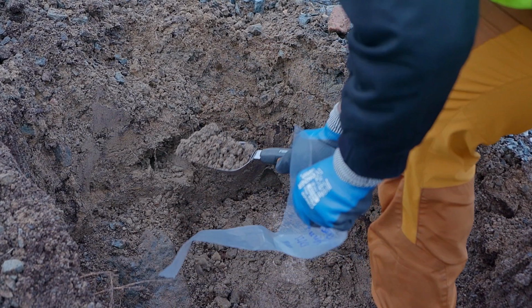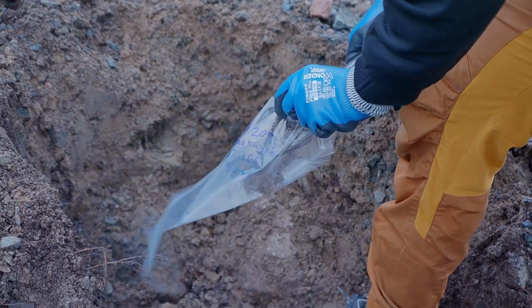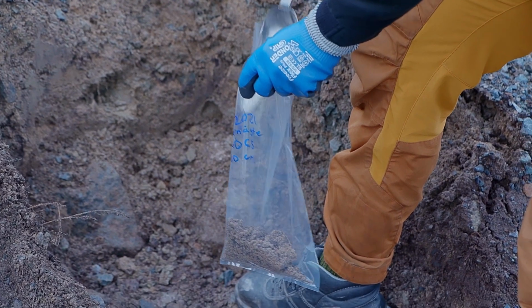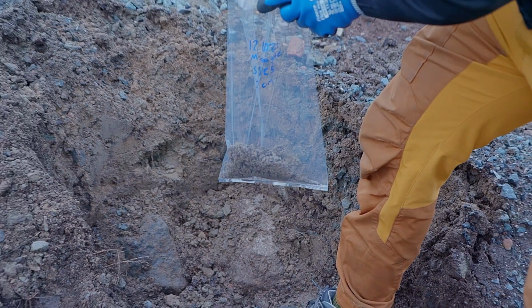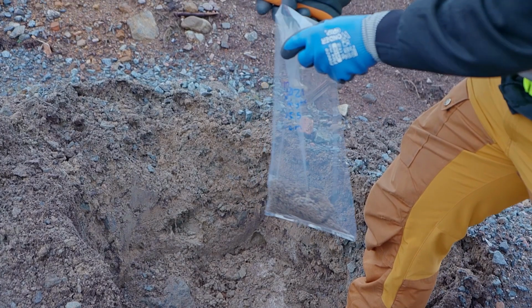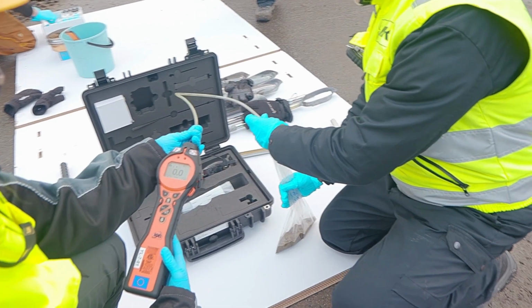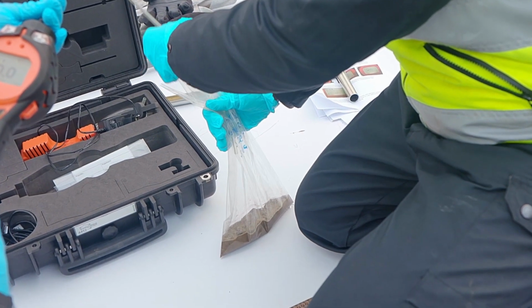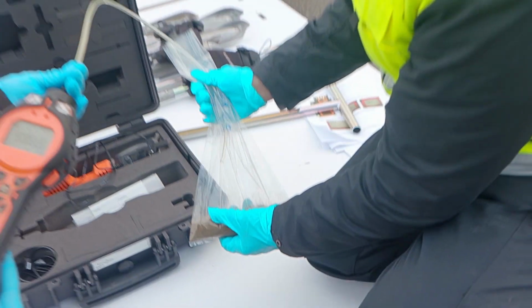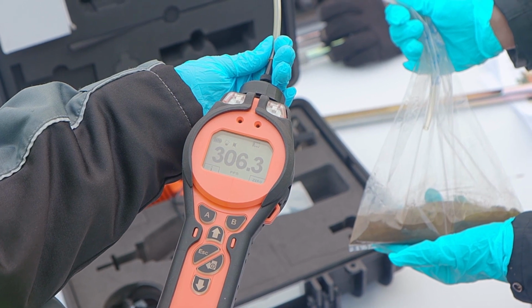Measurements can be taken directly from the soil or, for example, a gas-tight bag containing a soil sample. The gases move from the pores of the soil sample into the bag where they can be measured with the meter. The measurements are influenced particularly by the temperature, soil density, humidity, and the time the sample has been exposed to air. It is also important to note that the results are sum concentrations of all ionized gases volatilizing from the soil. If we know the volatile compound in the sample, we can choose the appropriate response factor in the device, which improves the reliability of the results given.